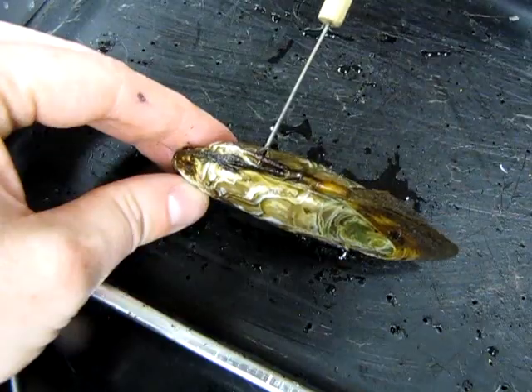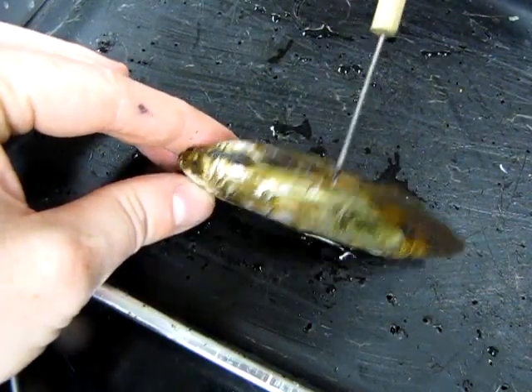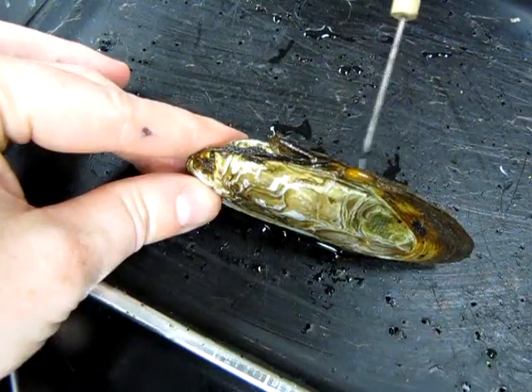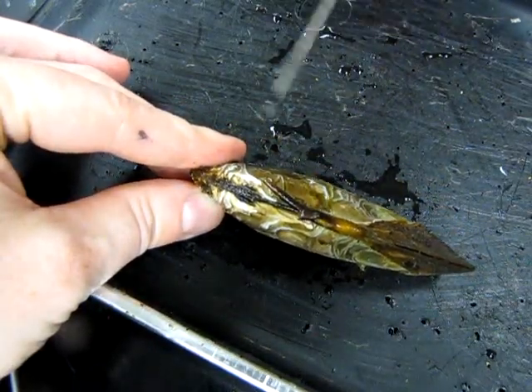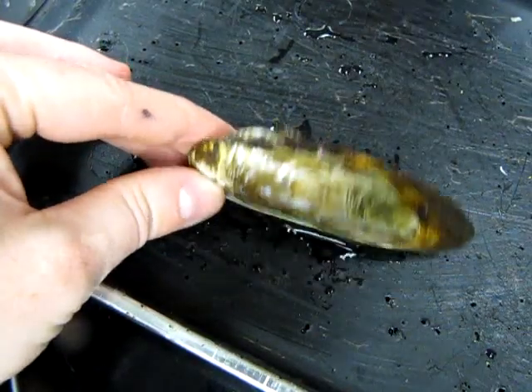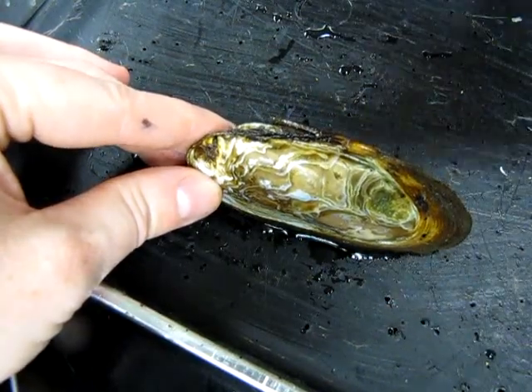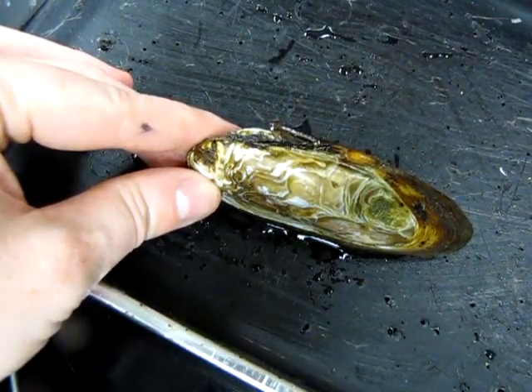While we're looking at this surface, there's this sort of rough-looking structure — a bit of it is peeled off — this is the hinge ligament. It's what's responsible for letting the clam shells open. It's very elastic. There are muscles inside the animal that we'll see later that hold the valves closed; otherwise, the spring ligament would allow things to pop right open.